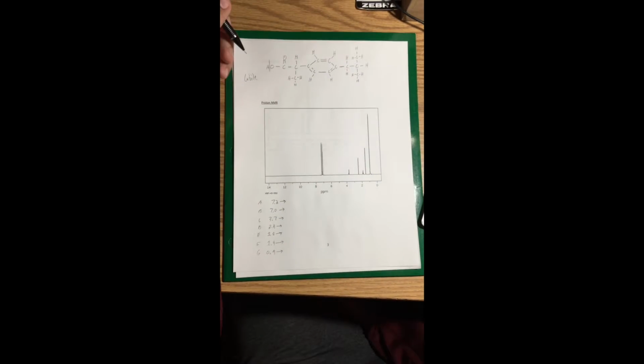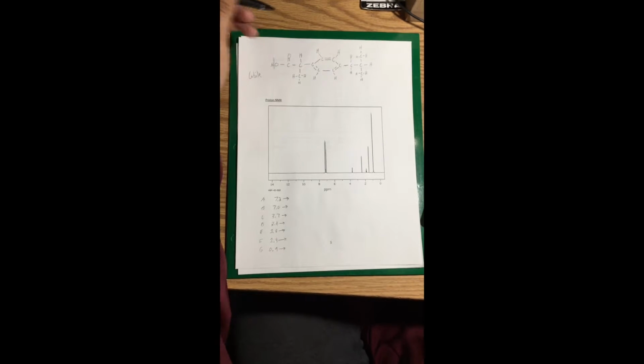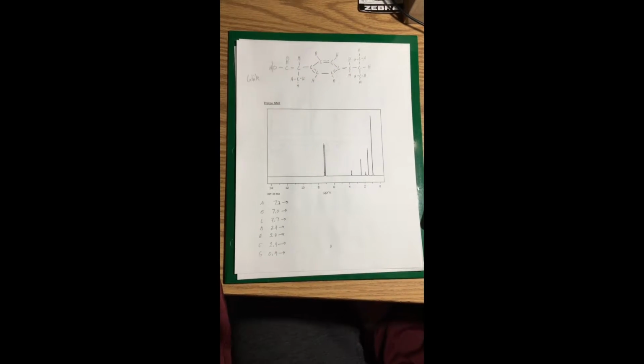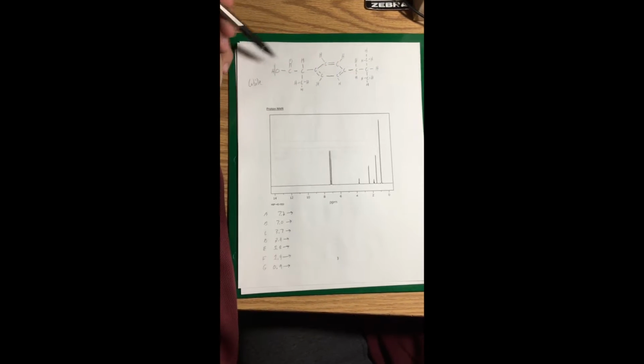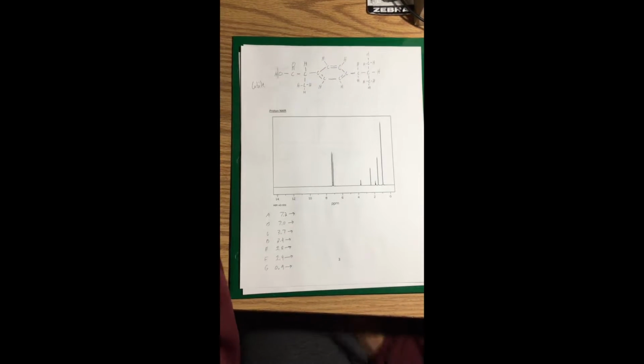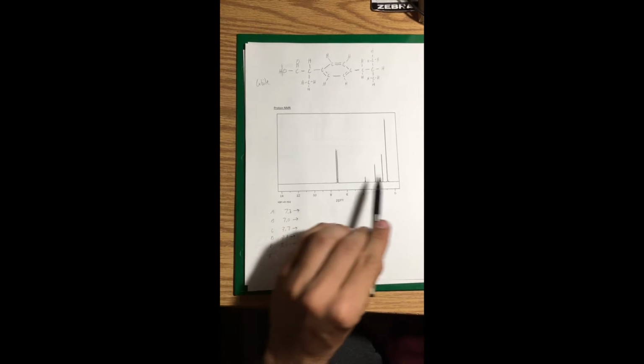So next we move into the proton NMR of the molecule. As you can see, I've drawn it out. You can see it's a very large molecule. We do have the aromatic and also the carboxylic acids featured in here. So now as we move down, I'm going to work this left to right for you.